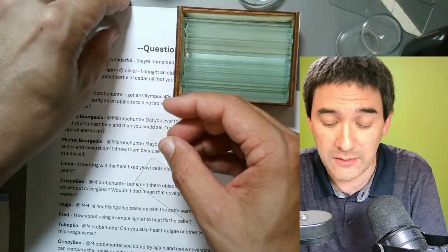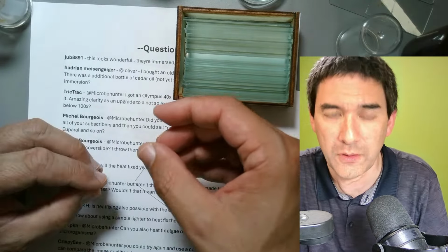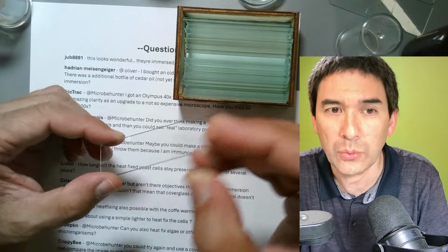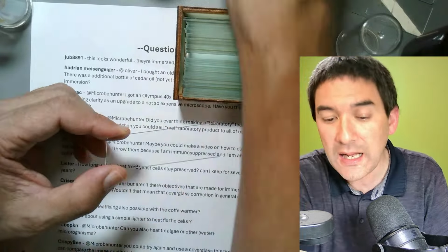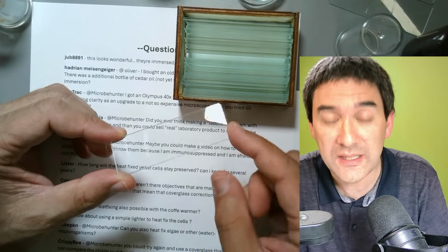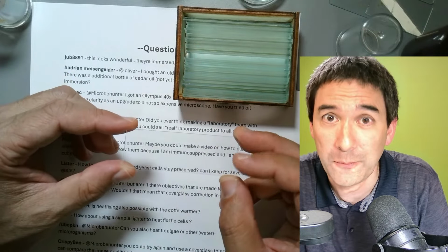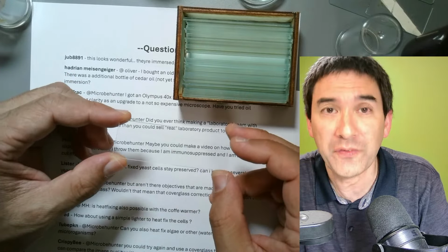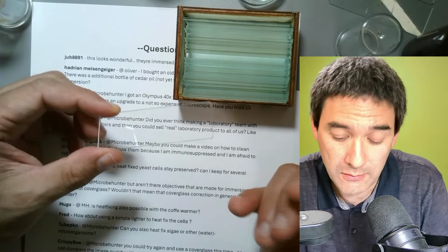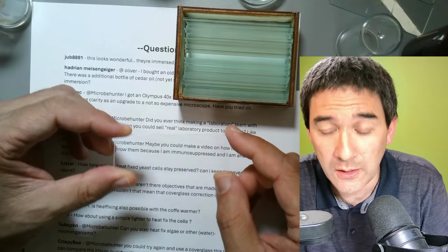They do break. Yeah. So sometimes what I do is I will throw the cover glasses away and simply rinse those slides. Another thing that I can recommend, this also kind of works, is you just take the slides as they are, remove the cover glasses and put them into your dishwasher. Okay, and then most of them come out pretty clean, some of them not, you just throw those away. But actually with a dishwasher it works quite well.